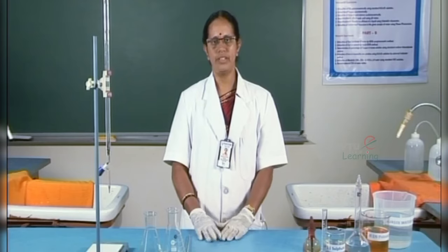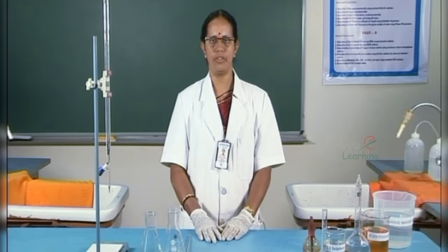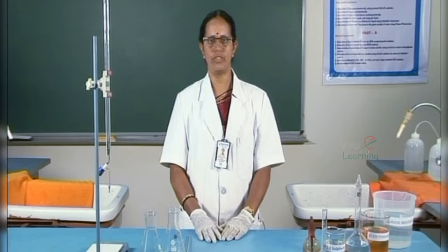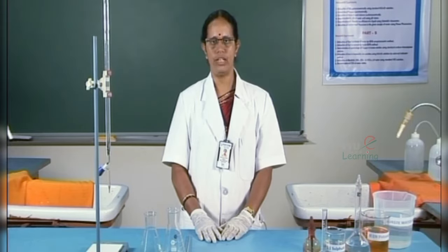The experiment is determination of COD of wastewater. The chemical oxygen demand determination is extensively employed as a means of measuring the pollution strength of industrial wastewater. Chemical oxygen demand is a measure of the total quantity of oxygen required for oxidation of organic and inorganic wastes present in 1 liter of wastewater sample. It is an important and quickly measured parameter for industrial wastewater analysis and water treatment plants.